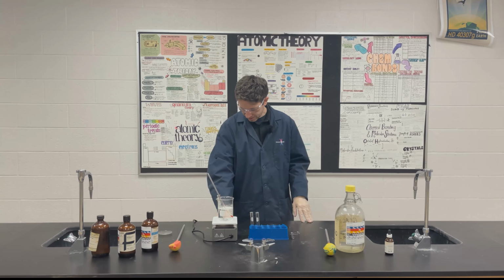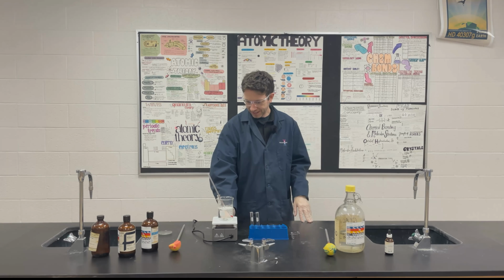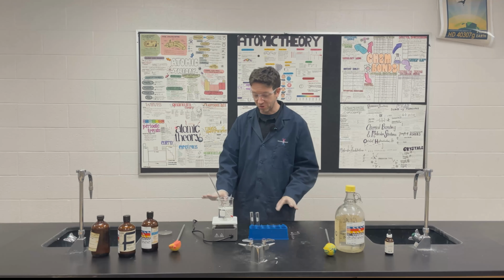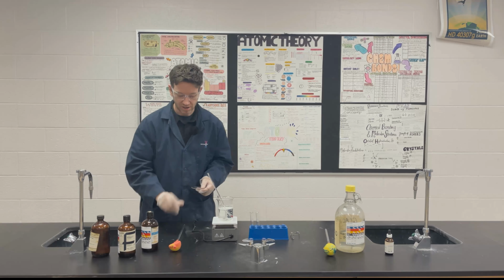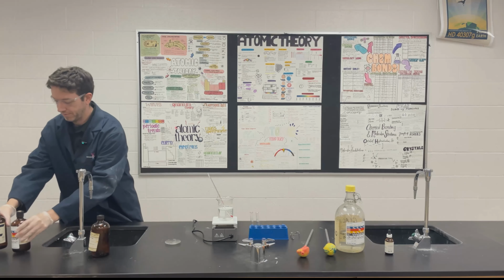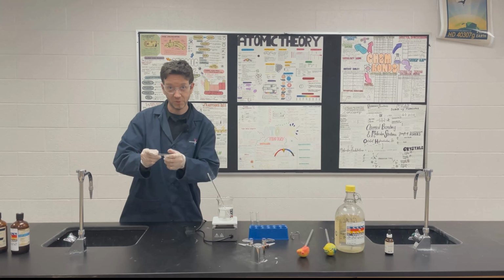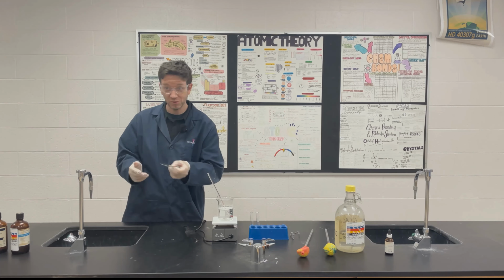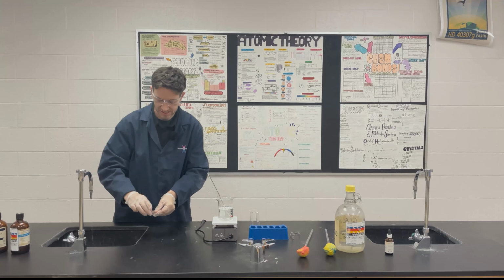All right, we're back. It's been about 5 minutes. Okay, I have to make sure the water doesn't boil. So once it gets close, if it goes above 80, you just want to put it on low or even off just to prevent it from boiling. Now, our evaporating dish. Let's move these out of the way. What we're going to do is we're going to fill the evaporating dish about half full with cold water. Tap water is fine, it doesn't really matter. Just like so.